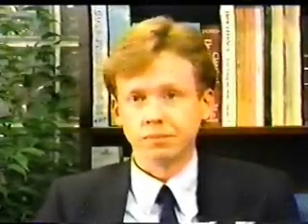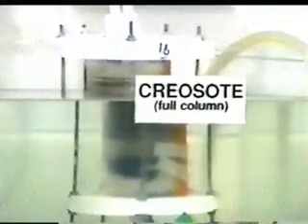One of our first tasks was to select and procure waste for testing. We wanted to select a group of wastes that represented as broad a range of waste properties as possible. Creosote sludge was selected and procured from a wood treatment plant. This waste has a heavy, very viscous oil-water solid emulsion that has a consistency very similar to mayonnaise.